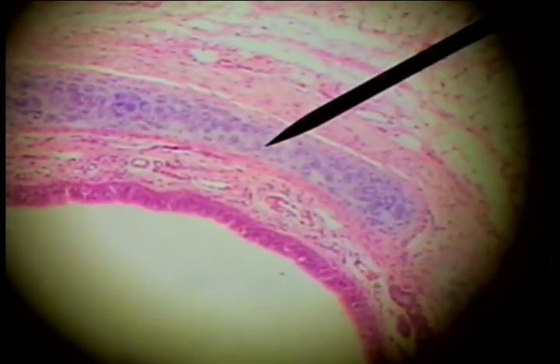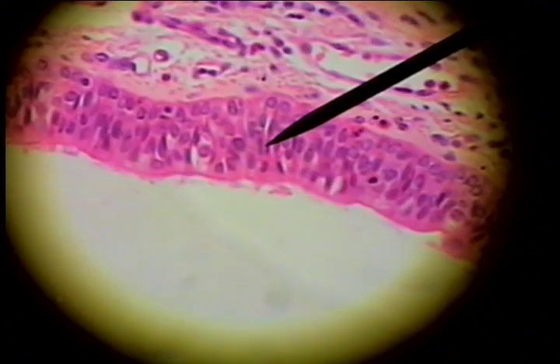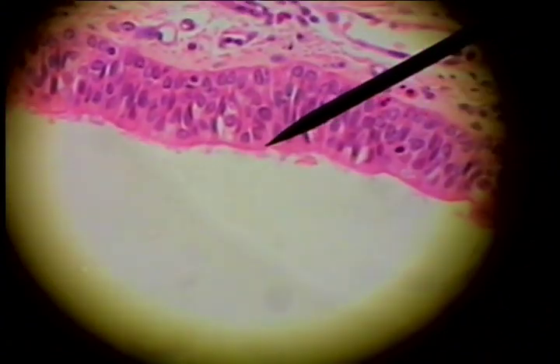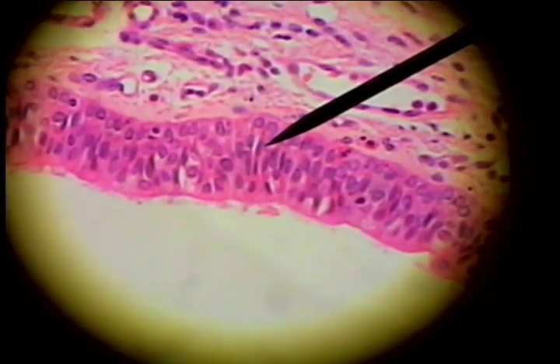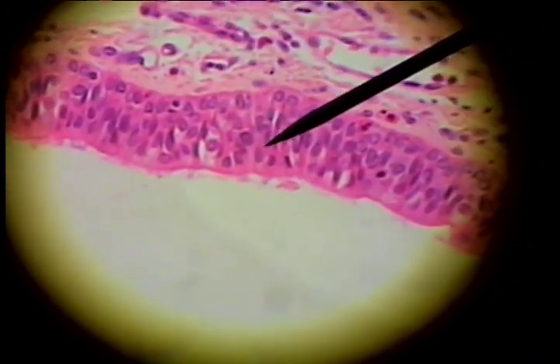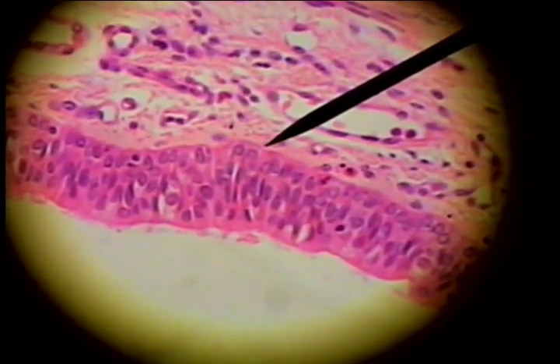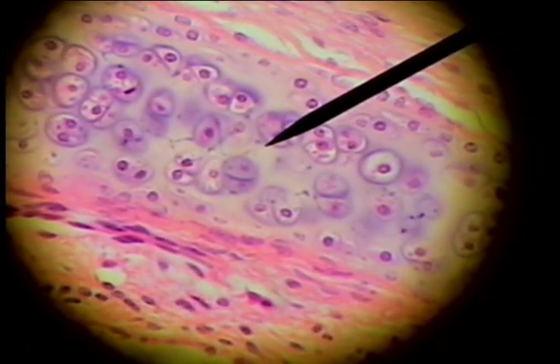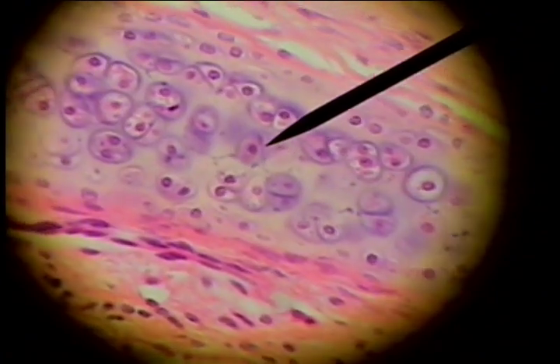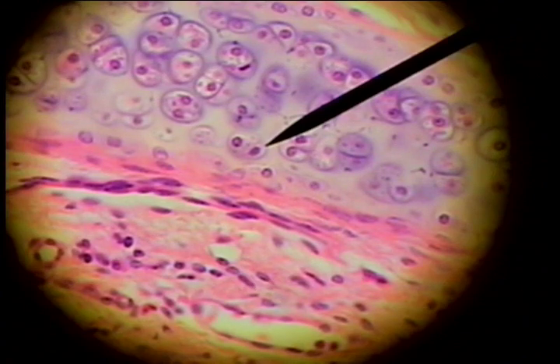The key, of course, to the identity of the trachea would be that it has pseudostratified ciliated columnar epithelium. Here are the cilia. Here is the pseudostratified ciliated columnar with the cell nuclei at very many different levels. Here is the basement membrane, and here again is the hyaline cartilage with the ground-glass blue matrix and the cartilage cells in lacunae in pairs.